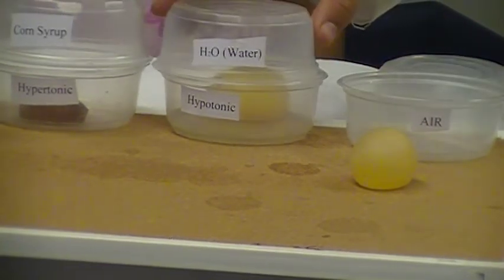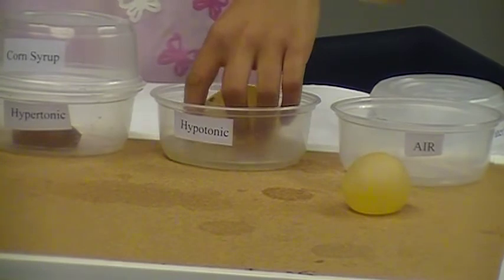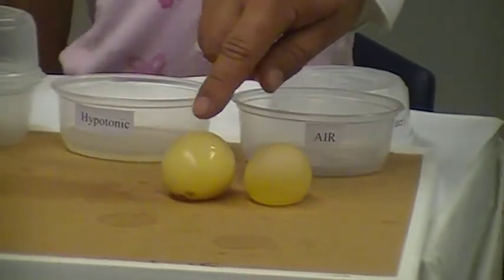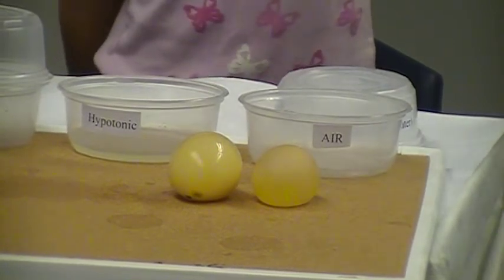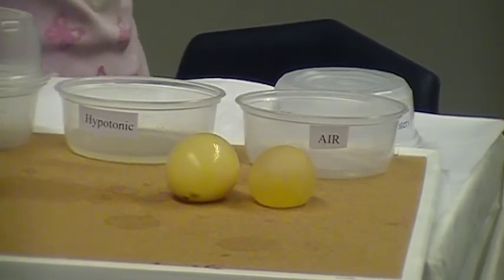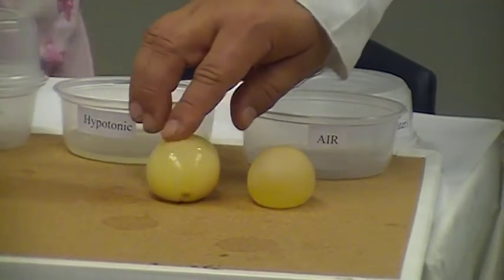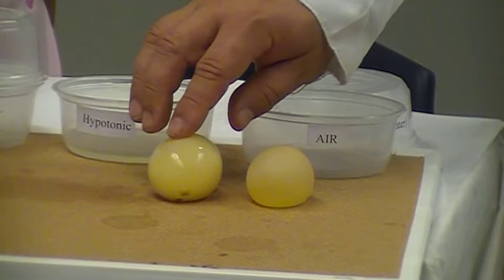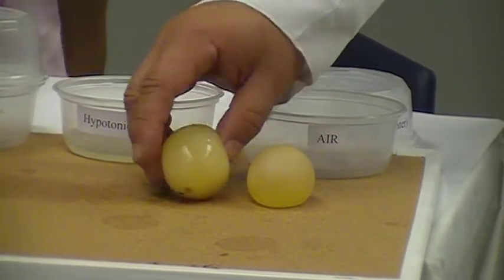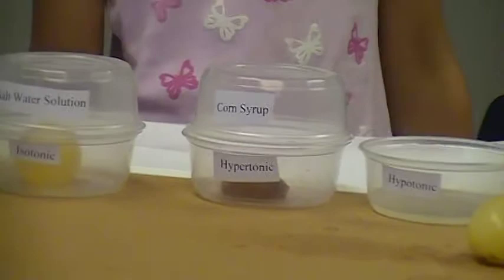Now the second container is labeled H₂O or water — it's what we call a hypotonic solution. Julia, can you take the egg out of that one? As you can see, the egg that has been sitting in the water is much larger than the control group egg. The reason for this is osmosis. Osmosis, by definition, is the movement of water through a semipermeable membrane from an area of greater water concentration to an area of lesser water concentration. As a result, the egg cell — having a lower concentration of water inside the cytoplasm and wanting to be in a state of equilibrium with the water around it — allowed water from the outside to pass through its membrane into it, filling it up and swelling it up.